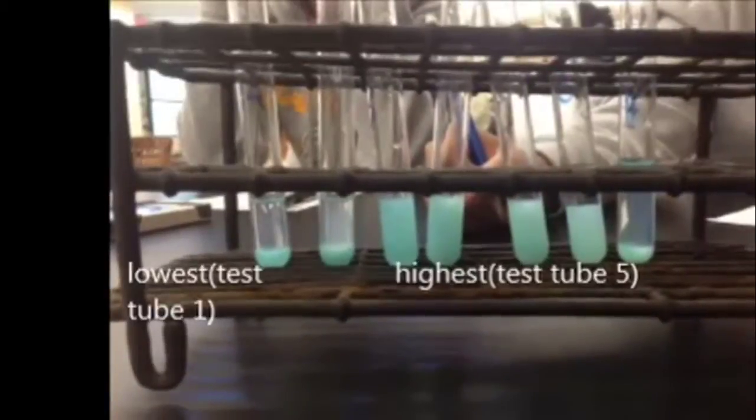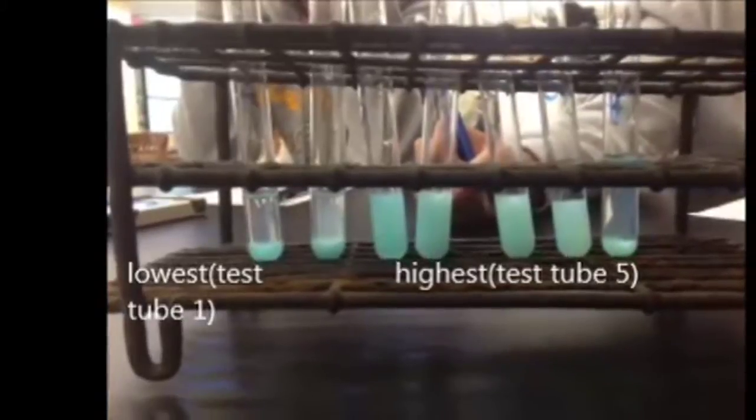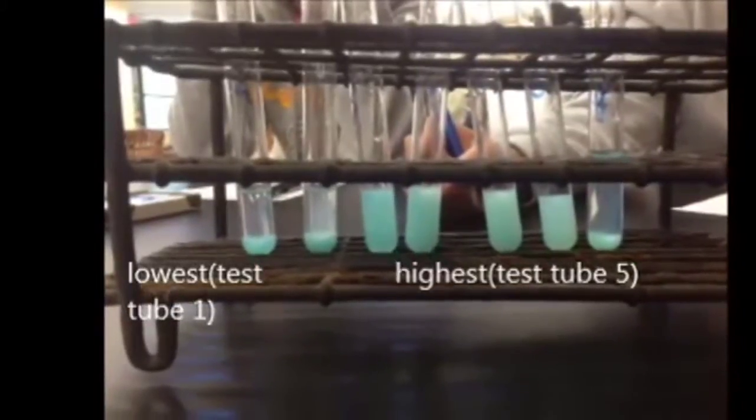The lowest test tube was test tube 1 because both compounds mixed well. The highest test tube was test tube 5 because it was the precipitate.